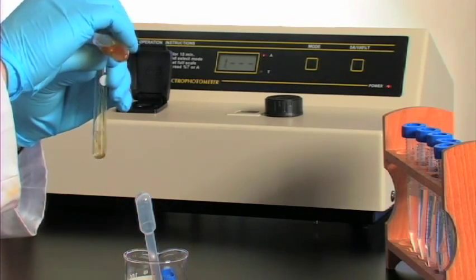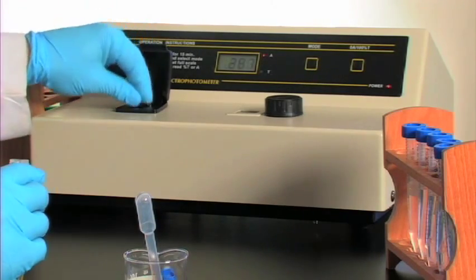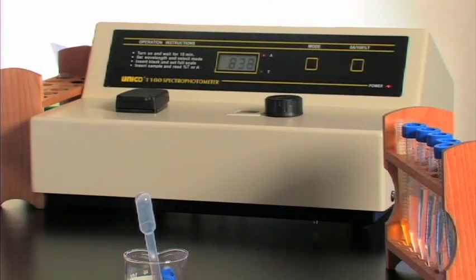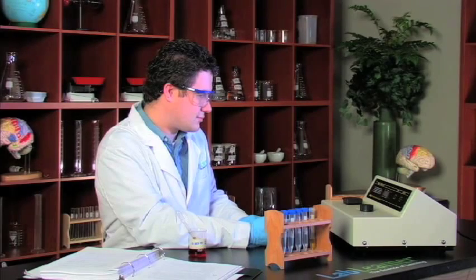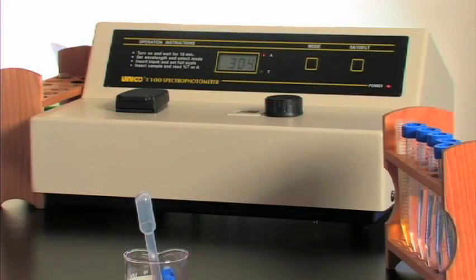He then pours a sample into the cuvette and introduces it into the chamber of the spectrophotometer and begins reading. As we look at this reaction on the spectrophotometer you can see that it has an absorption of 0.8 something and that number is decreasing as we watch it. What we're actually looking at here, and this is quite fascinating, we're looking at the disappearance or the using up of the iodine as the reaction progresses. We're looking at the disappearance of one of the reactants rather than the formation of the product. So he's going to take this all the way down to zero which will mean that there's no more iodine.